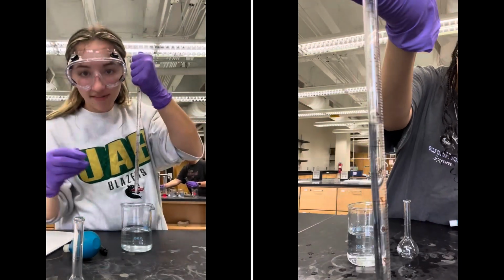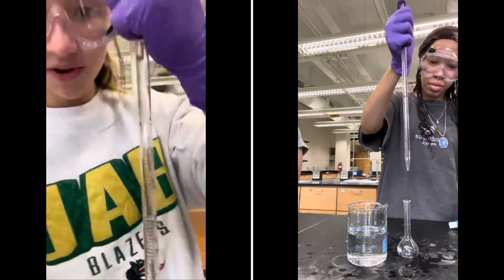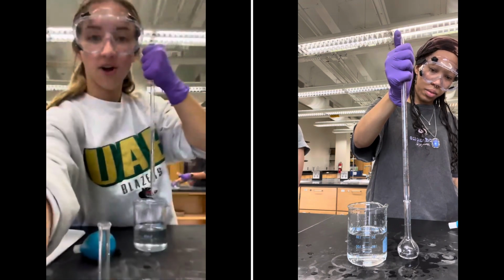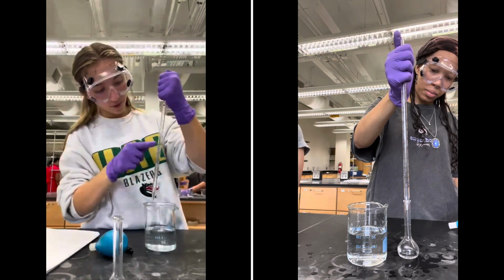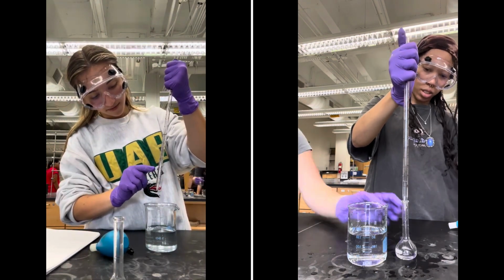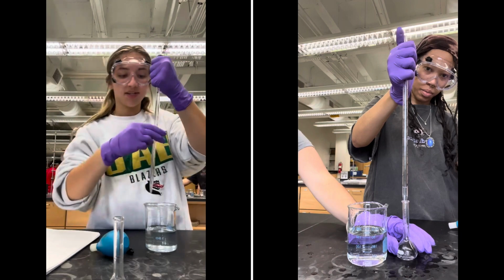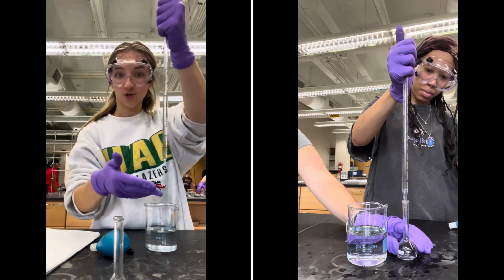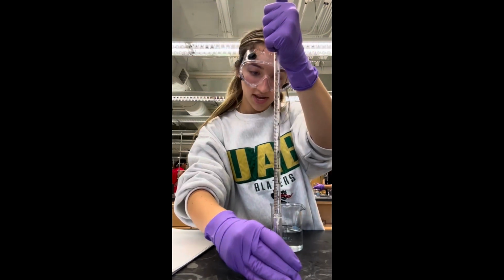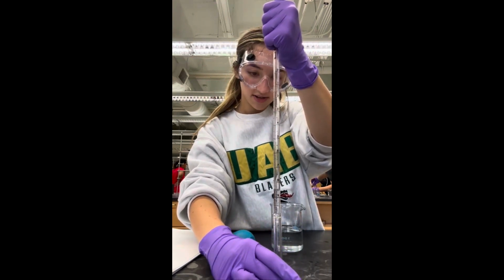And right there we have 6 milliliters, and if we put it up a little bit closer, we can see right there the meniscus is hitting right on that number. And we're drawing up to 4 because we're going to do 1, 2, 3, 4, 5, 6. That way we have our true 6 milliliters. And I'm going to go ahead and transfer it into this flask right here. Get it all in there.